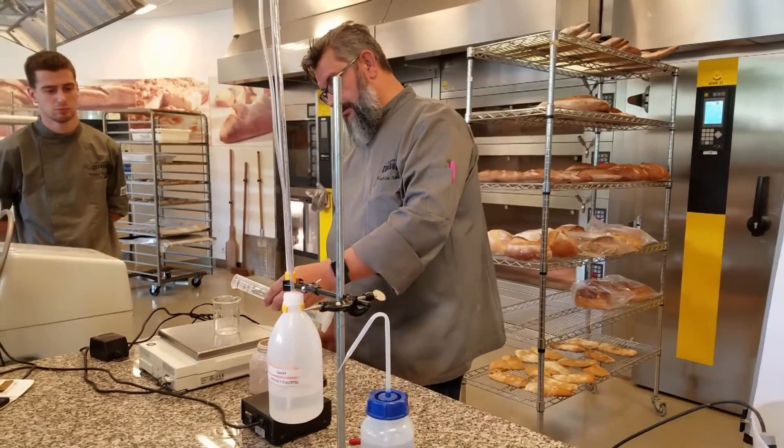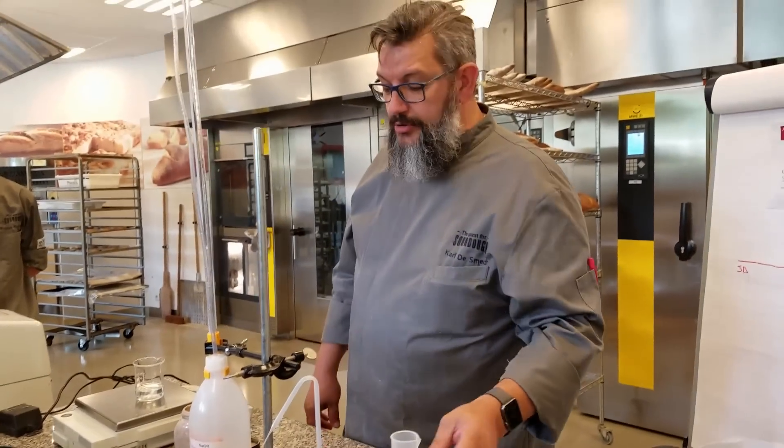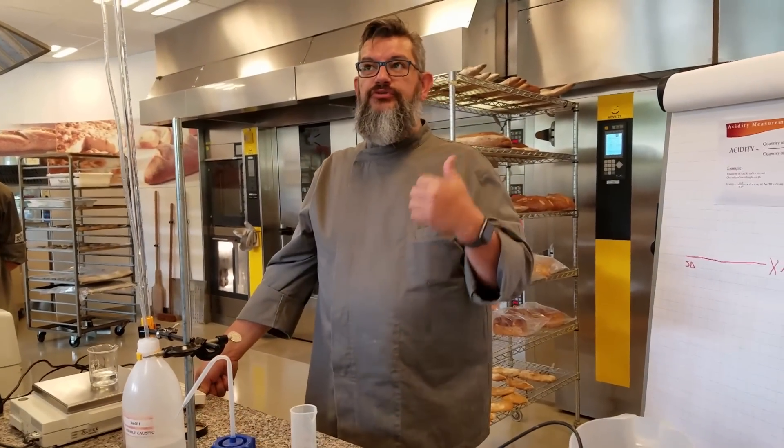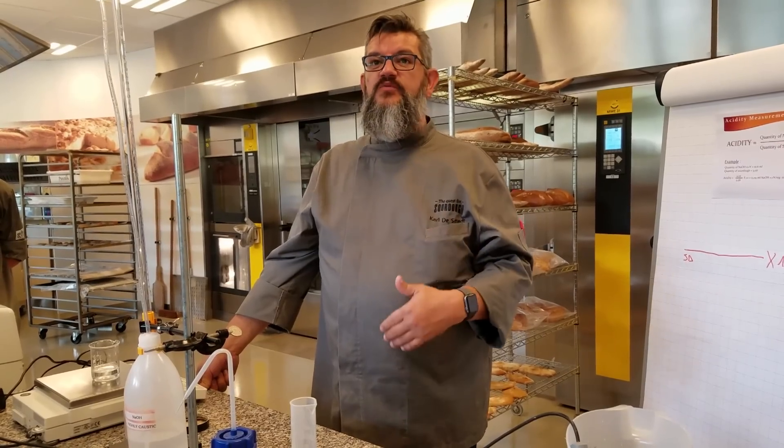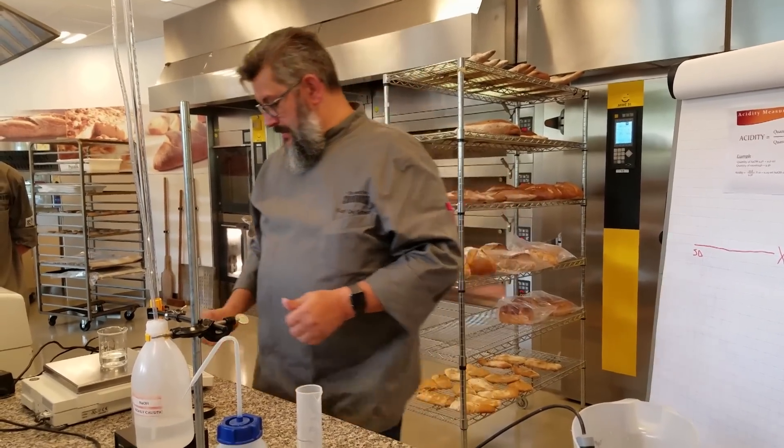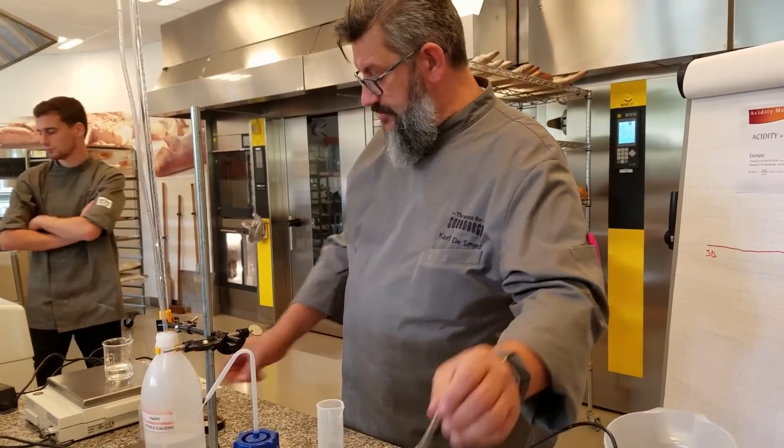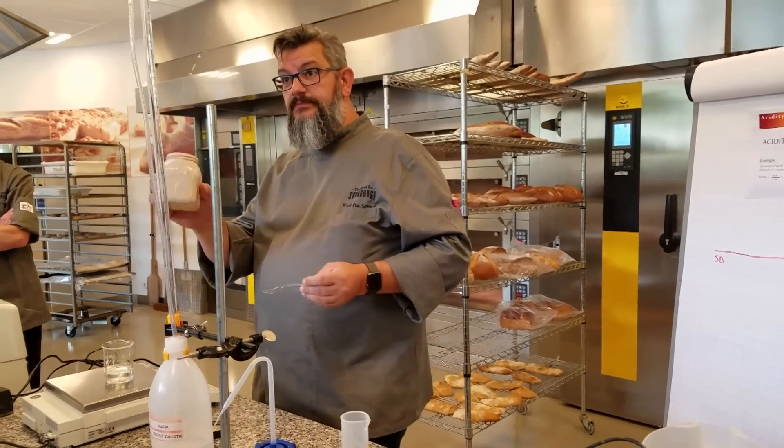Can you quickly tell us what we are doing? We are going to measure the amount of organic acids that will be found in a sourdough. So I need 10 grams. I'm taking your rice sourdough.